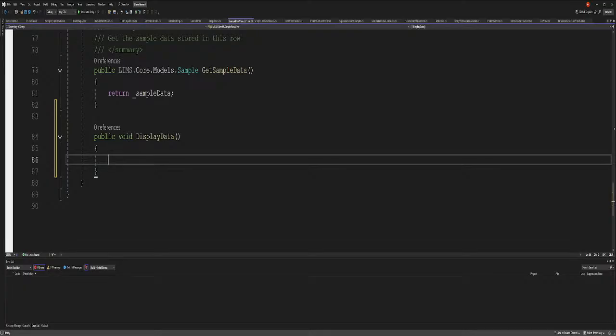Sorry, my notes here. So sample row click. All right. In order to do that and make sure that's working, let's go back here, and then we look for a window that I believe we did. Sample type. No, not the sample window. Here we go. We got the sample window.